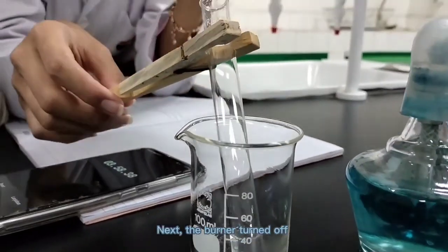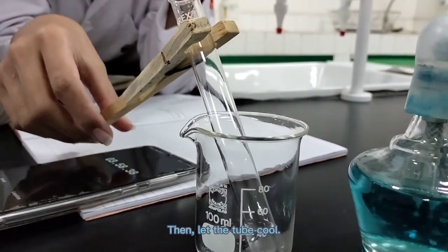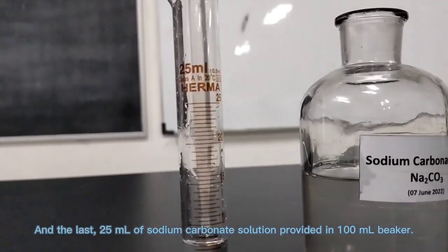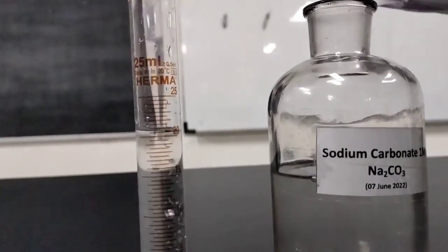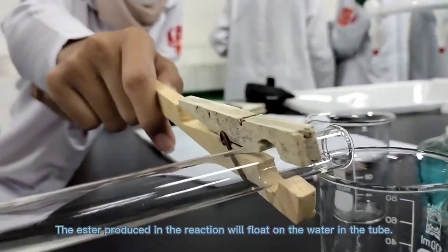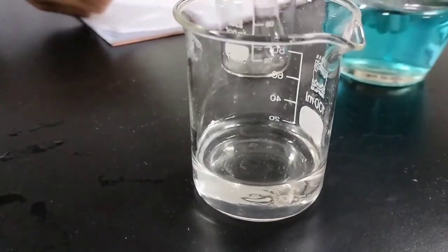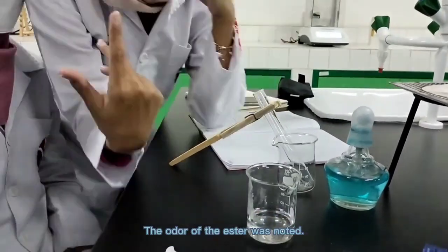Next, the burner turned off and the test tube was removed from the hot water bath. Then let the tube cool. And the last, 25 ml of sodium carbonate solution provided in a 100 ml beaker. Then the mixture was added into the sodium carbonate solution. The ester produced in the reaction will float on the water in the tube. The odor of the ester was noted.